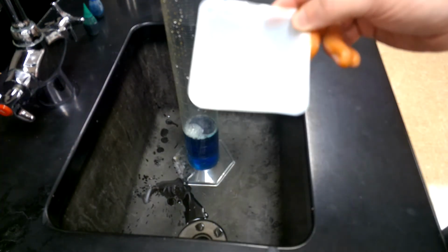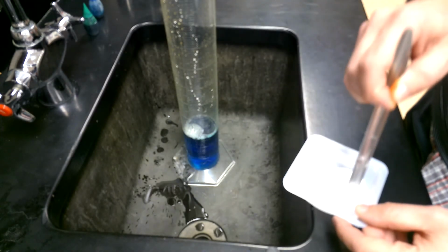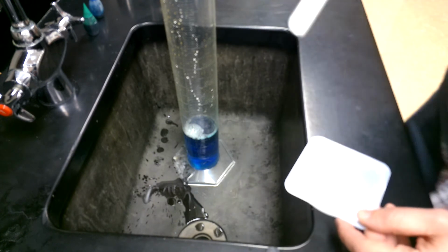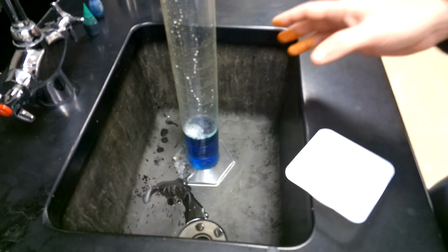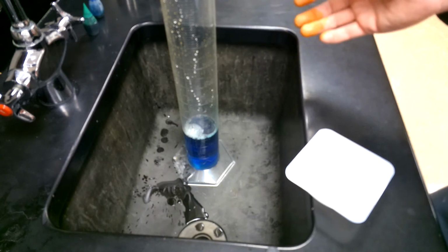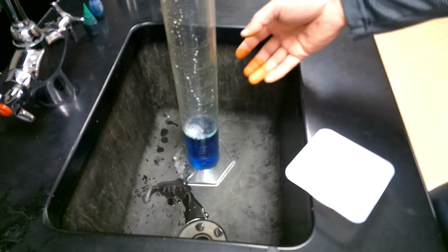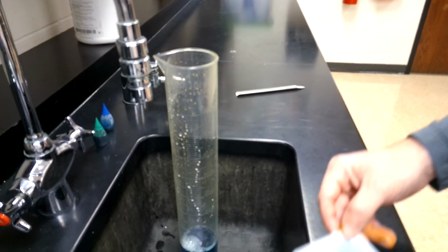In addition to that, I'm increasing the surface area of my potassium iodide by crushing it up a little bit more. So I'm increasing surface area and I'm increasing concentration, both at the same time, while adding a catalyst. About the only thing I could do to make this go faster is I could preheat it, which I've seen people do, and that's usually how they do it on YouTube to get it going really good. And I could maybe stir it too. So you could get a stir rod or something in there. We'll see if this is impressive enough just with increasing concentration.